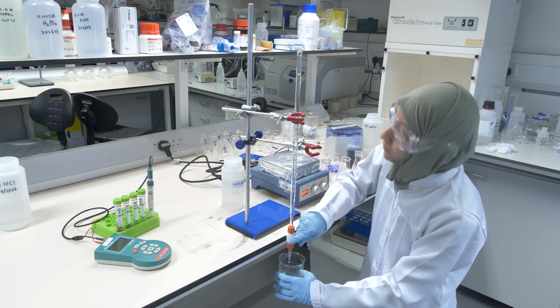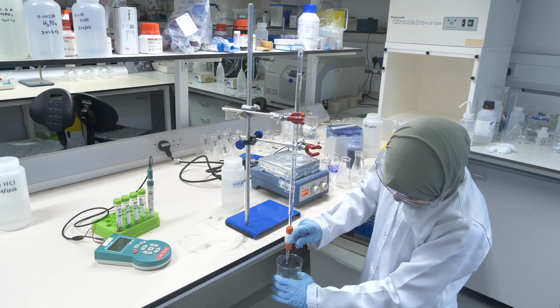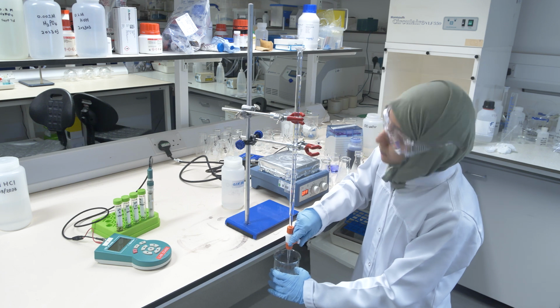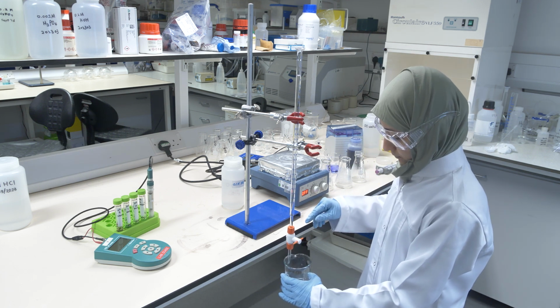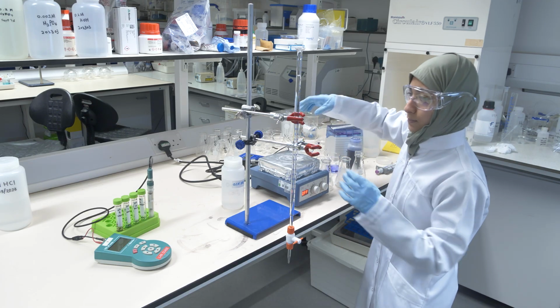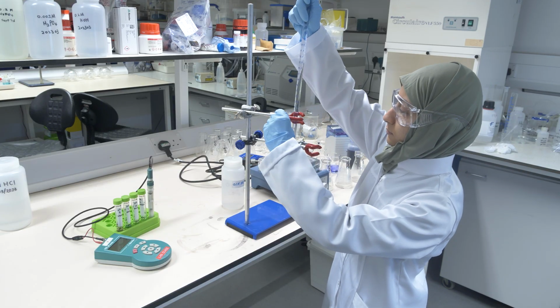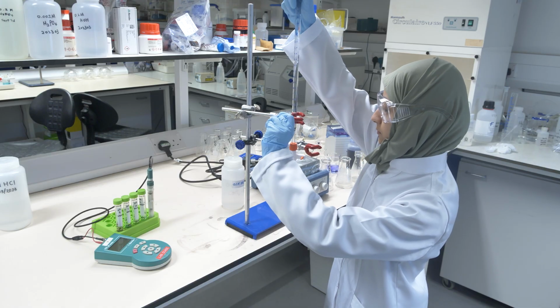Check if the meniscus forms at the lower part, the meniscus is at 0. Very, very careful. Of course it's important that we are careful, because we need to know exactly how much acid we add to our filtrate. So now she prepares everything so that you can put the filtrate and the magnetic stirrer under the burette.